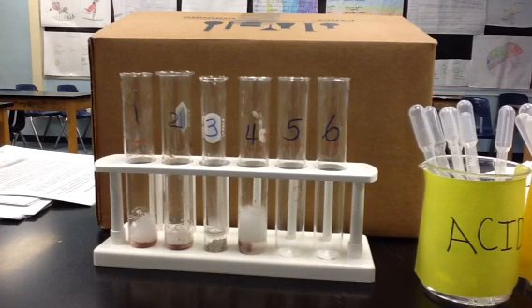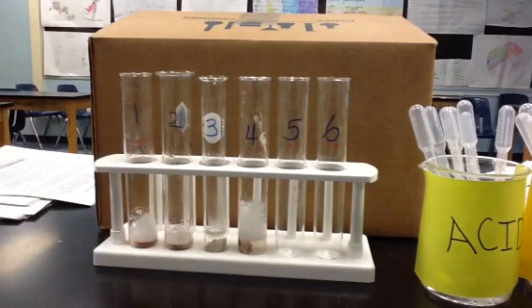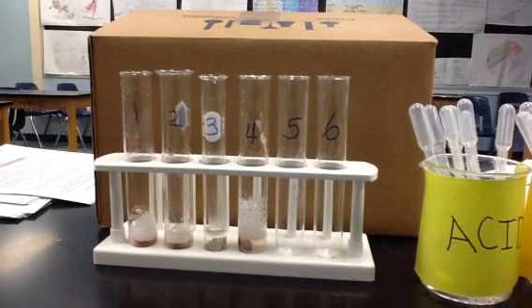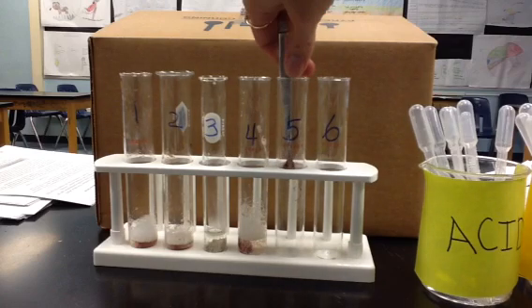And there is. So the bubbles, ooh, look at that, it's still going. It's still bubbling at the bottom. Bubbles are still being released. It looks like it went pretty high. Let's take a look at a different pH. So that was a neutral pH.